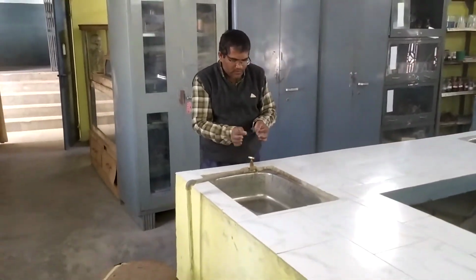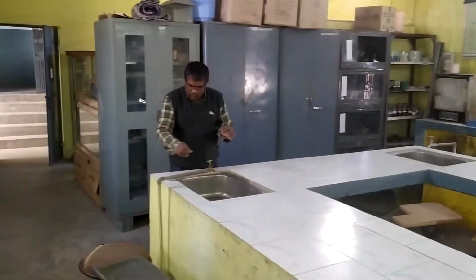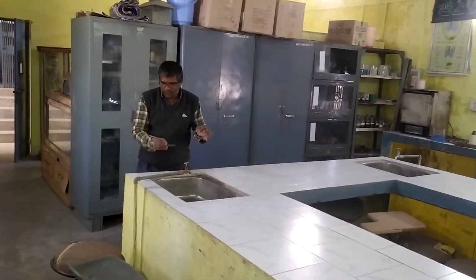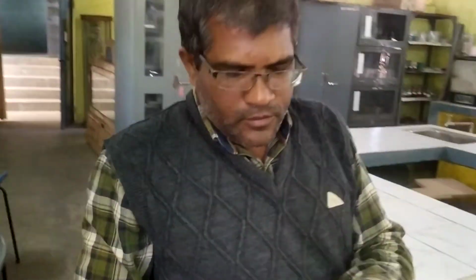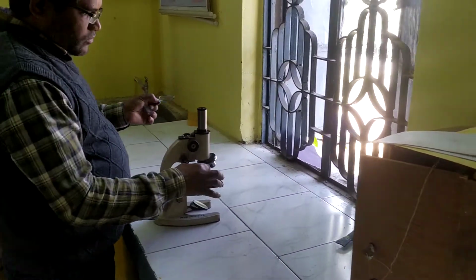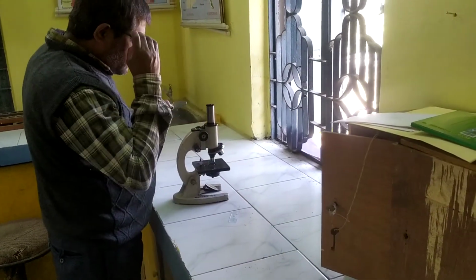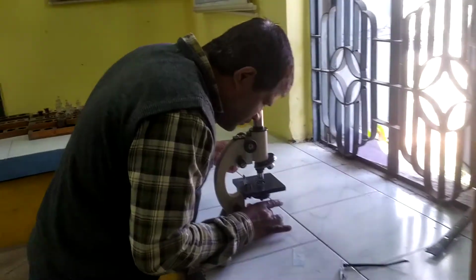So let's see this slide under the microscope. In the microscope, first we have to mount the microscope properly, and then we have to fit this slide under the microscope.